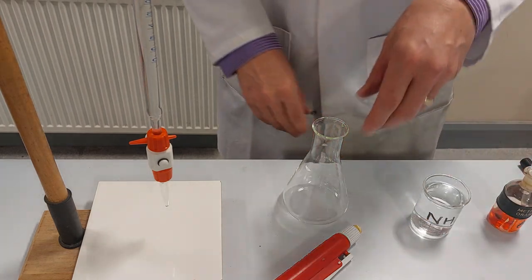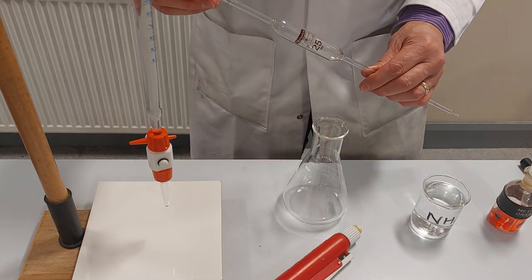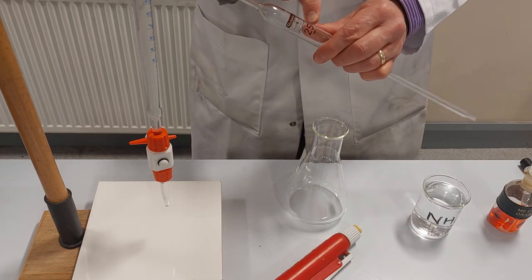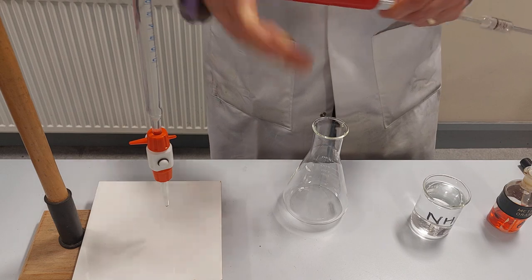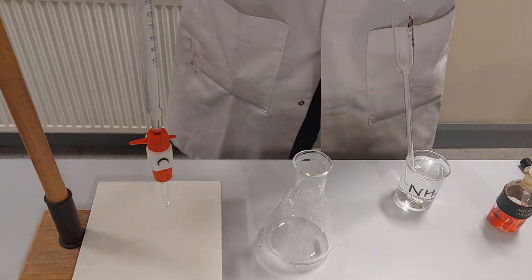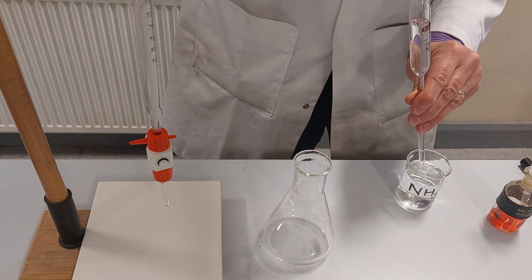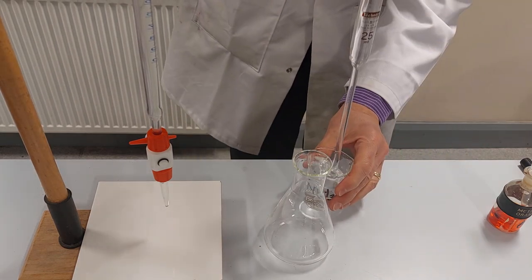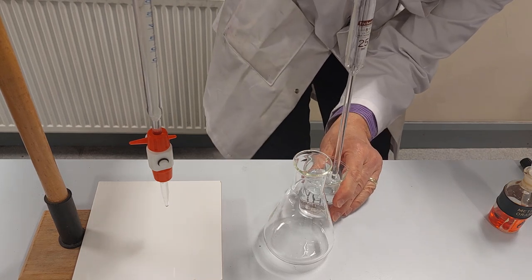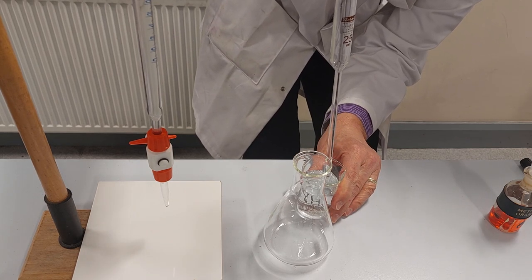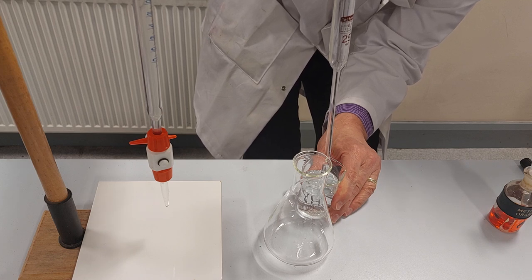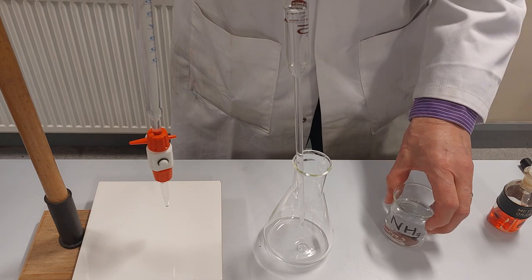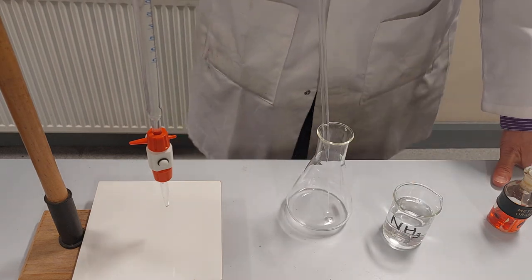Now I need to measure out my ammonia. I use this piece of apparatus called a pipette. It's a long thin tube but it's got one line on it there. The line shows us exactly where 25 centimeters cubed is. I fill it with this pipette filler which I wind like that and then the solution fills up all the way to the top. I'm actually going to take that off and then slowly come down here. Eye level on the brown line. There we go. I might have missed it by a minute bit there but the first titration is often rough anyway.